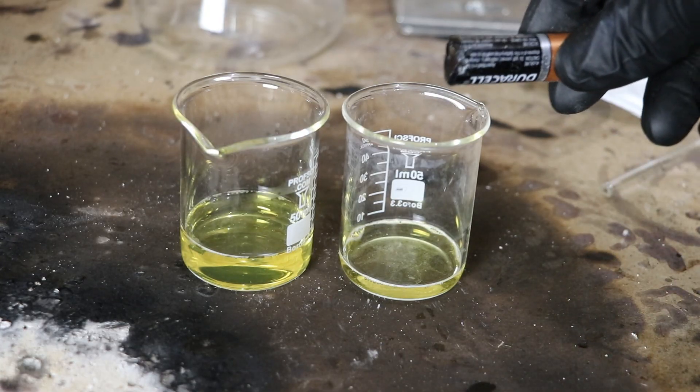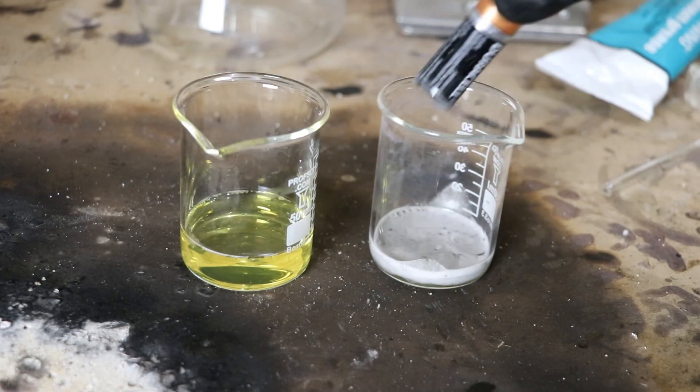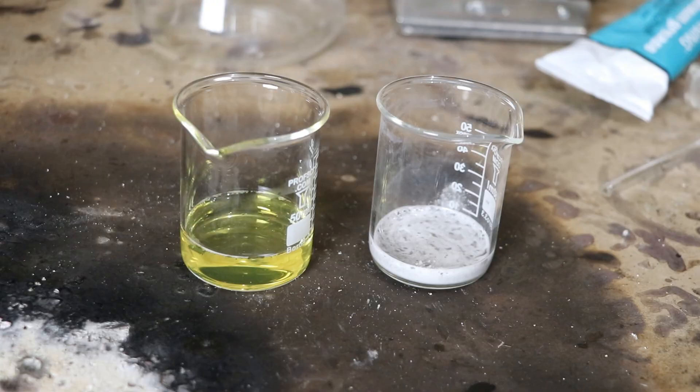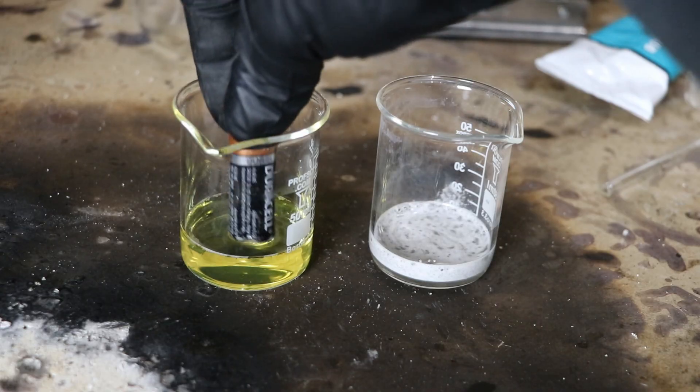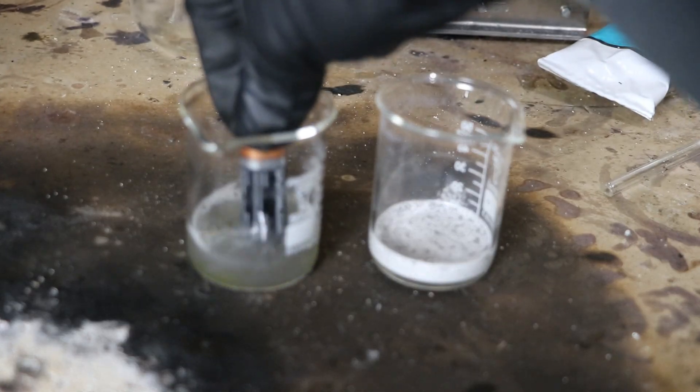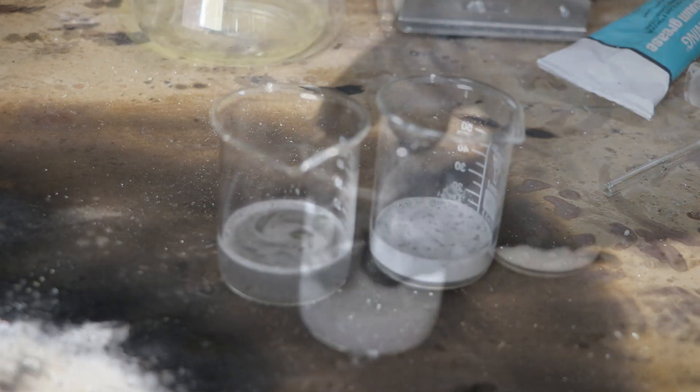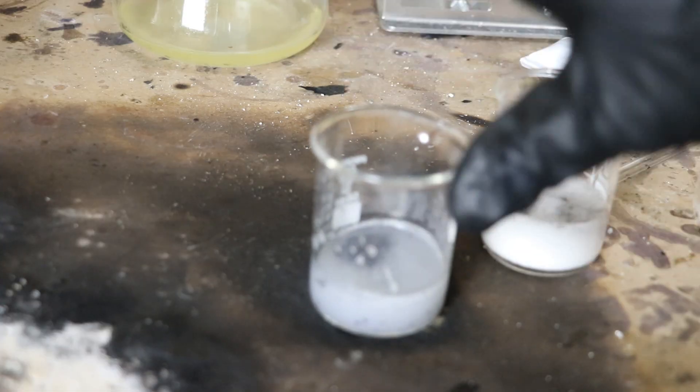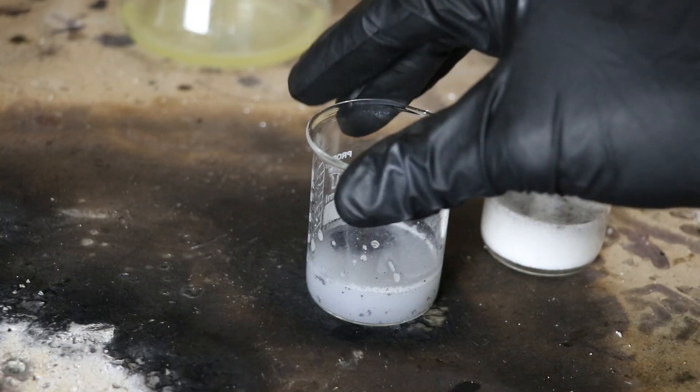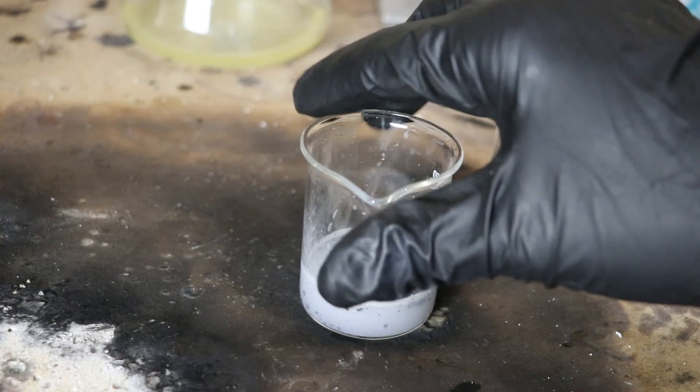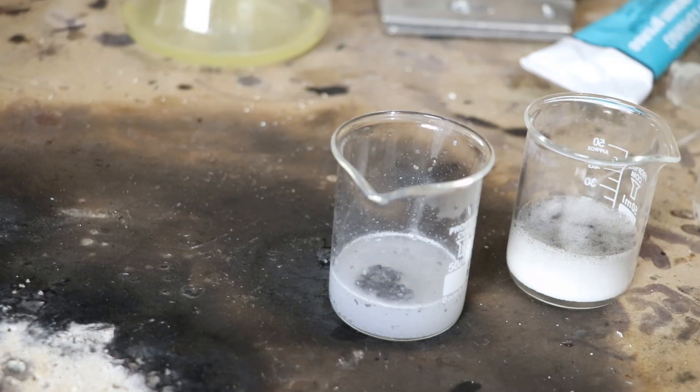Okay. So I've busted the end of this battery. So we've got a little bit of manganese. This thing you can see, lots of foam. All right. Let's do the same thing over here. Okay. Tiny little bit of peroxide. Not very much though. So obviously I need to improve my process quite a bit.